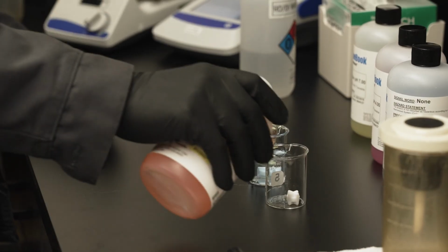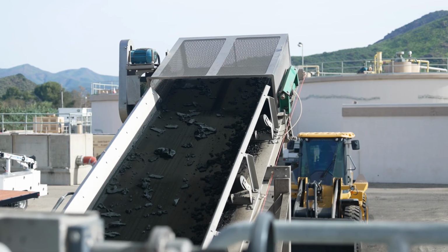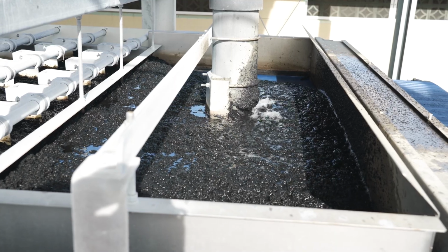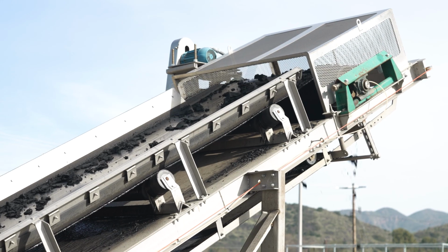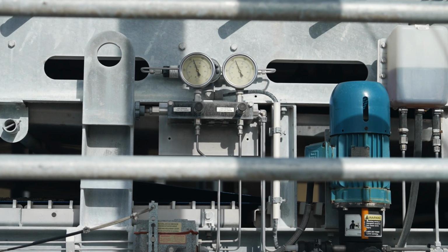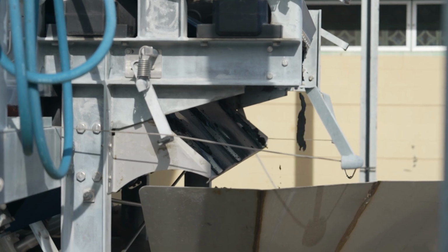It's many of the same tests we do on the treatment plant water, plus toxicity testing to ensure nothing entering the environment harms the wildlife that lives there. The biosolids that result from the treatment process, which is the solids coming out of the plant, it's almost like fertilizer once it's treated, also get tested for all sorts of salt, bacteria, and other contaminants to make sure they're clean enough to be further composted and used as fertilizer. We also test the bacteria levels of drinking water samples for the Camarillo Water Department.